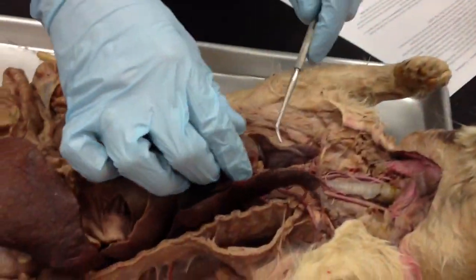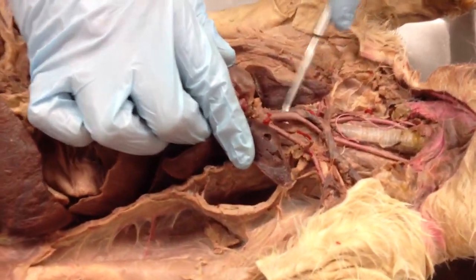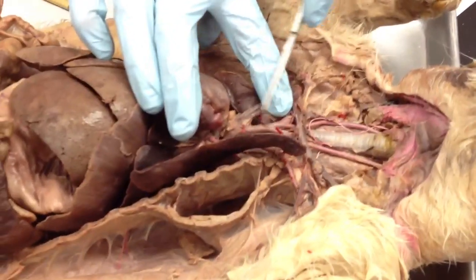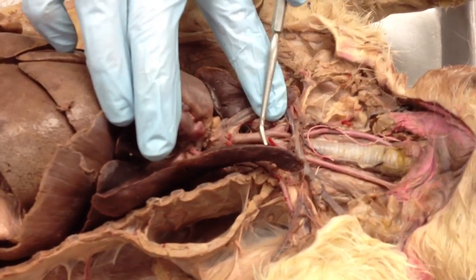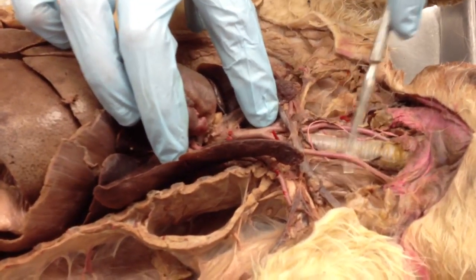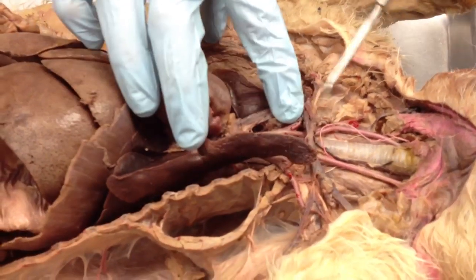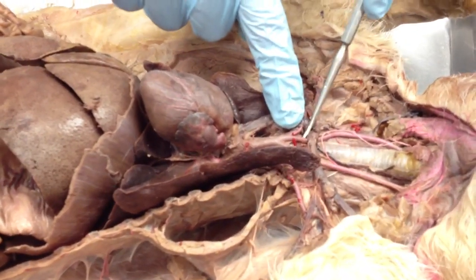Alright, so back to the brachiocephalic artery. So remember, aortic arch, left subclavian artery, brachiocephalic artery. And notice that brachiocephalic artery right there is a very small section of what they refer to as the brachiocephalic artery. It's like that right there. And then it branches off here at your left common carotid, and it branches off here, your right common carotid. See that under everything? So brachiocephalic, left common carotid, right common carotid.